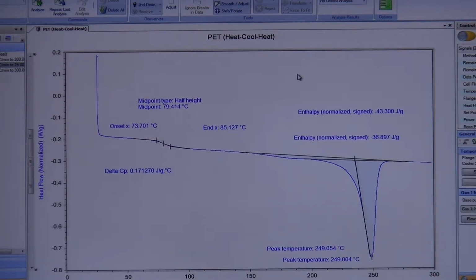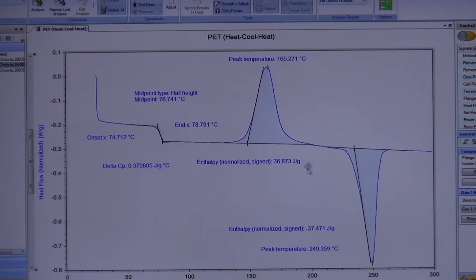So that means the first heating cycle is not... It depends on what you're there to measure. If you wanted to measure your first heating, if you cared about what the material originally looked like, then your first heating is important. Now, if you didn't care what your original material looked like, then your second heating would probably be the important one to you. Okay? And that's what I was explaining before, if you were synthesizing your sample, perhaps the first heat's going to look like this, but that's not necessarily the original material or the material in its equilibrium state, because this all happened because you were synthesizing your material and because you precipitated it and because you filtered it and did all these other things. Those impart thermal histories to your material.